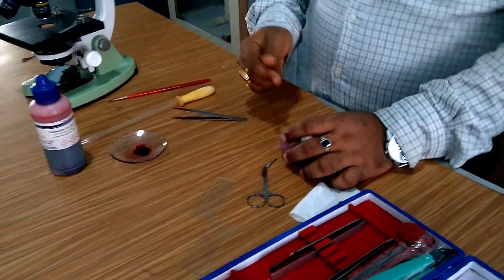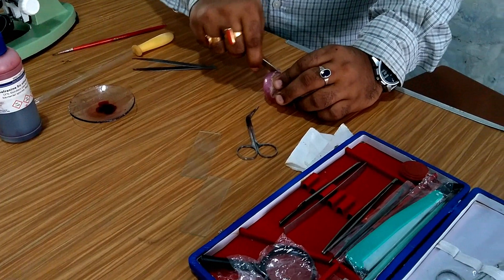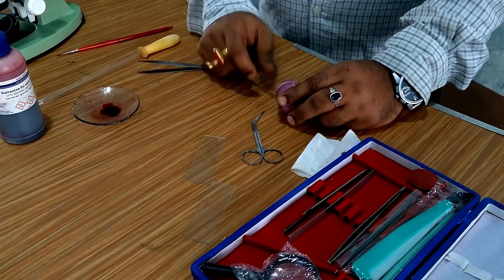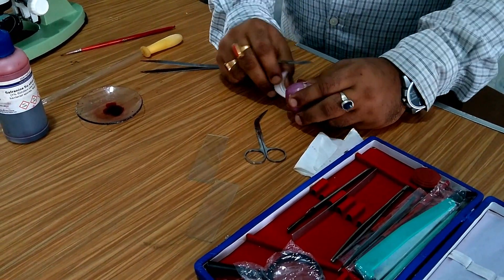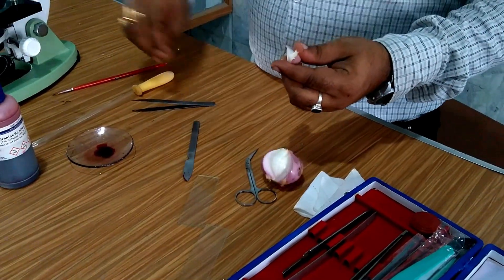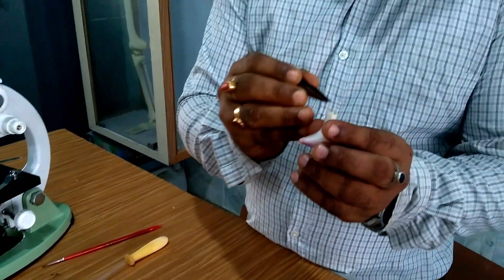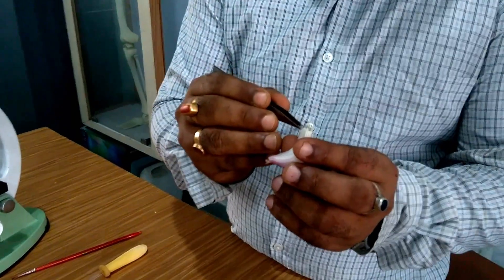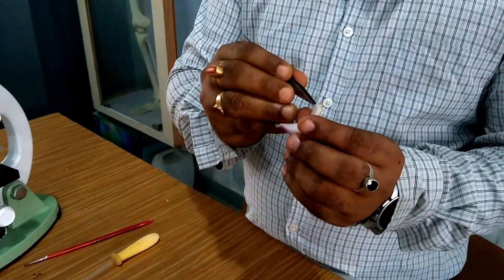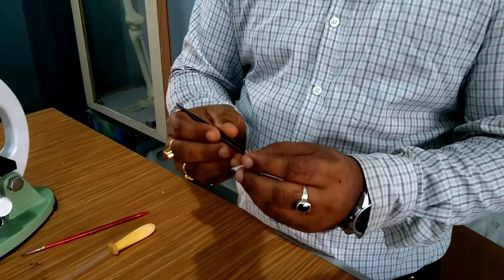You need to cut a piece of onion with your scalpel like this. After this, you should take a forcep and try to separate the bulbs of onion.